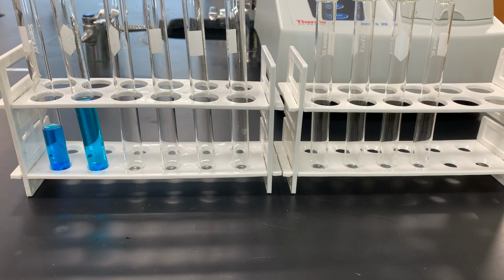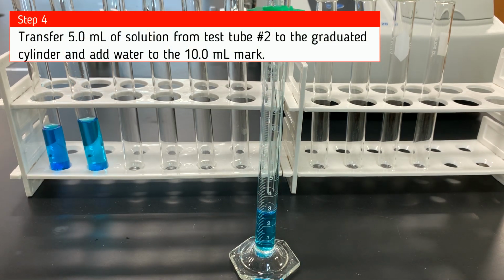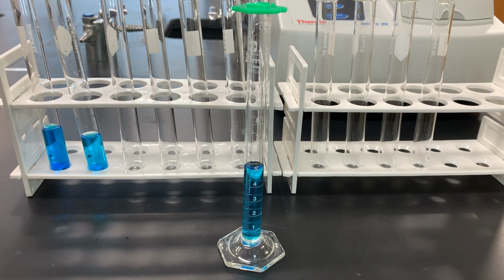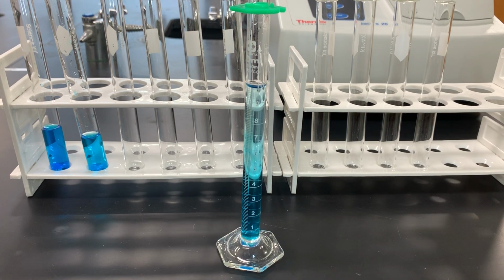Then what I'm going to do is take 5 milliliters out of test tube number 2 and put it in the graduated cylinder. And then I'm going to add water to that graduated cylinder to dilute it again. These are 1 to 2 dilutions. I'm going to keep doing this until I have 10 test tubes of solution.